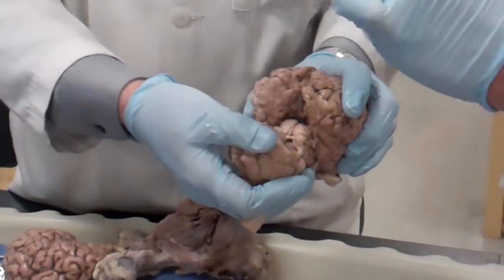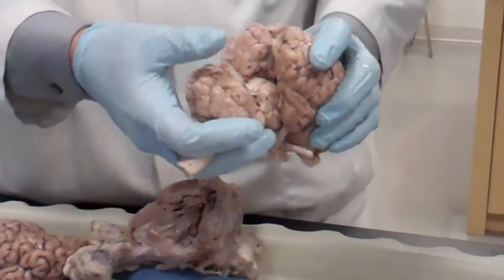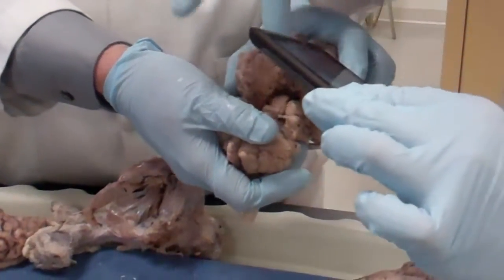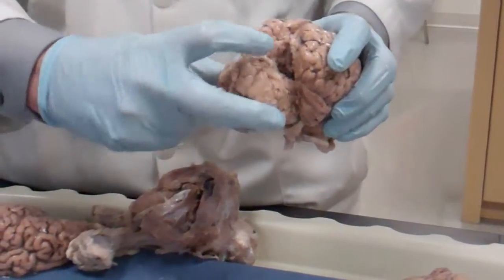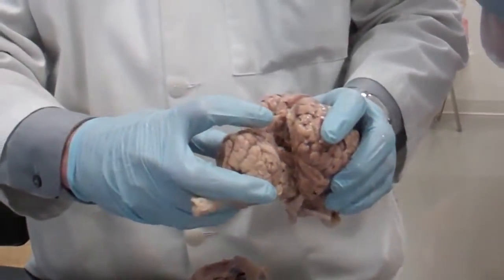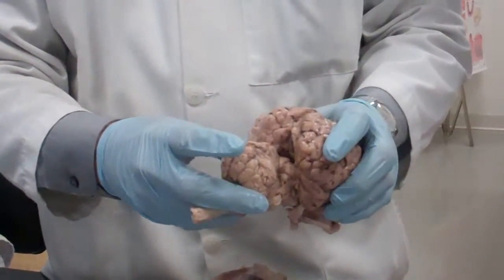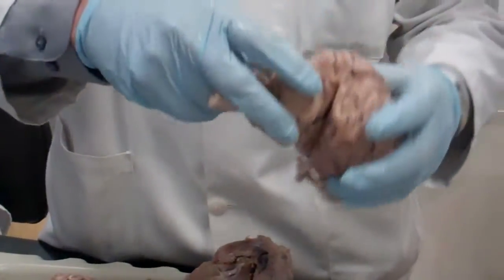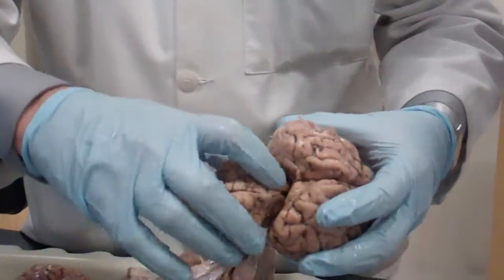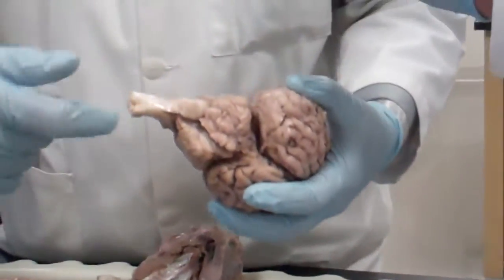If you move further with your finger and go to the back and flip the brain, you will see four bumps. These are the superior and inferior colliculi — together they make up the corpora quadrigemina. Superior and inferior colliculi. Now, we have the middle of the cerebellum, which is the vermiform — or the vermis — which is the body of the cerebellum. These are the two cerebellar hemispheres. The superior and inferior colliculi together — all this is the midbrain.